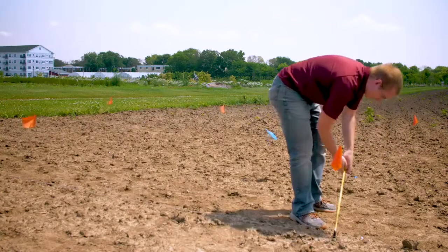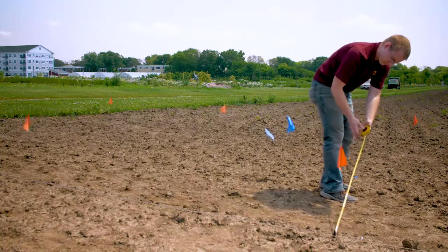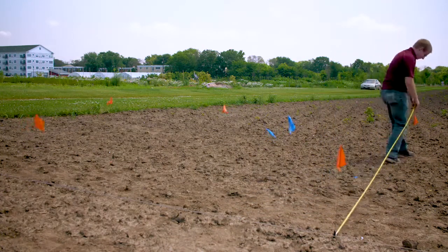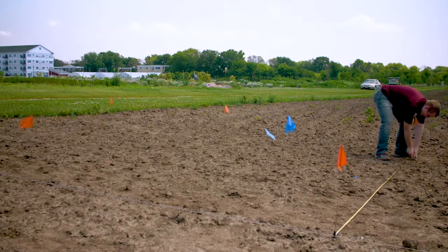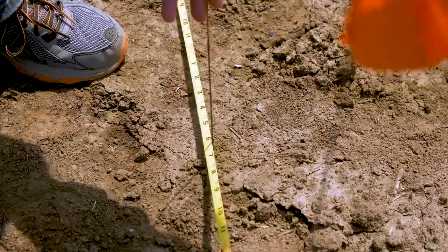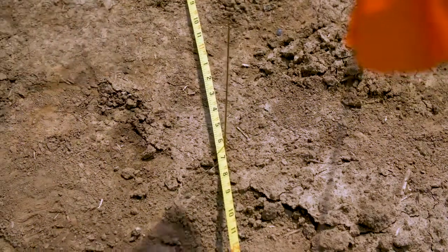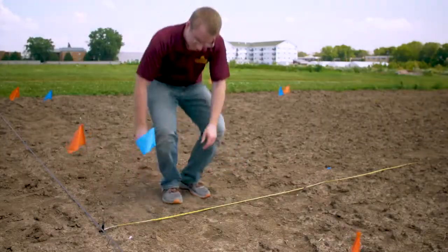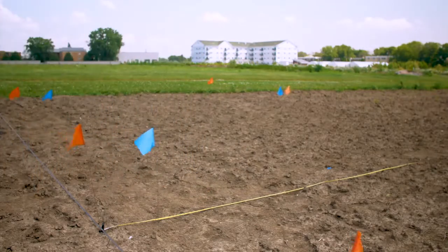Establish a 2.4 by 3.8 meter microplot area centered on the width dimension for collection of all the nitrogen-enriched plant and soil samples, leaving 0.38 meters of unsampled border on the length and width dimensions to minimize any edge effects. Then delineate the treatment plot and microplot corners with different colored flags.